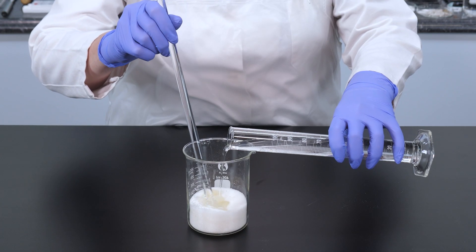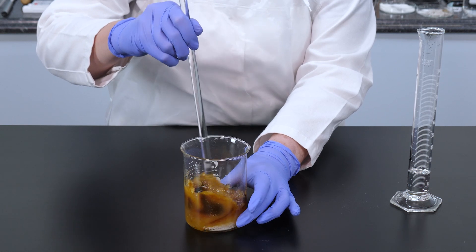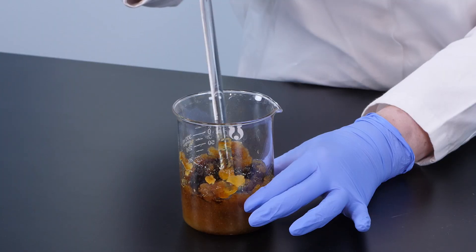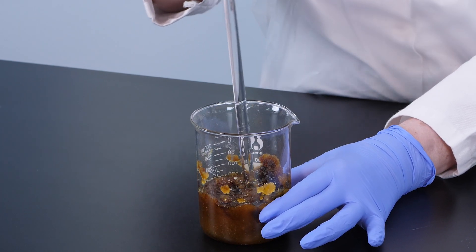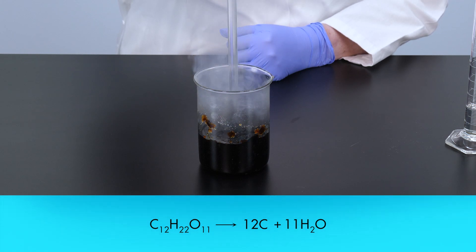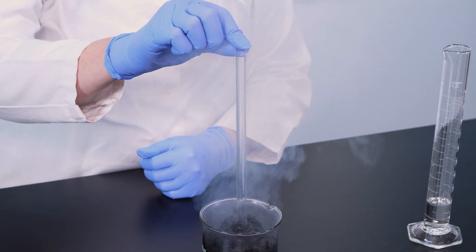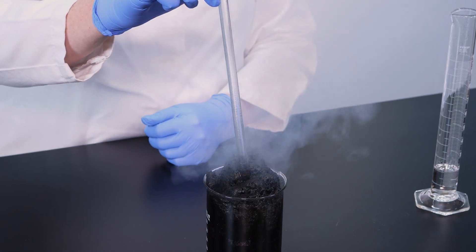A decomposition reaction breaks down a compound into its component elements. We will perform an experiment to break down sucrose into its component elements—carbon, hydrogen, and oxygen—using a decomposition reaction. For this experiment, we add concentrated sulfuric acid to sucrose. Watch what happens. During this reaction, the sucrose molecules decompose into carbon, hydrogen, and oxygen atoms. As soon as the elements separate, the hydrogen and oxygen atoms recombine in a ratio of two hydrogen atoms for every one oxygen atom to form water. The chemical reaction produced enough heat to cause the water to boil away, leaving only a residue of black carbon.